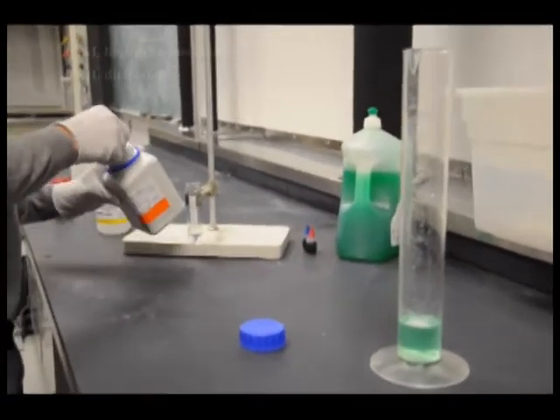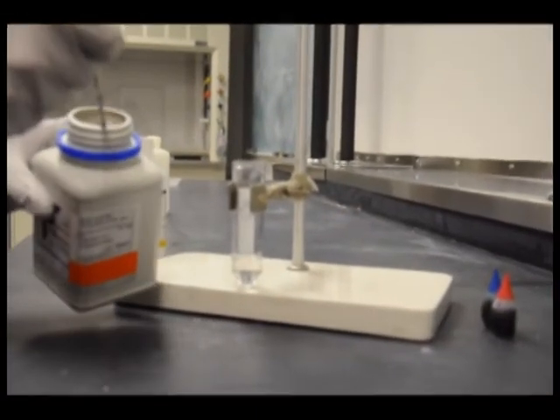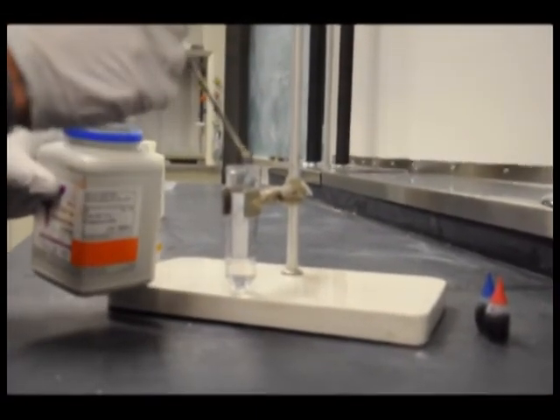Now you must create a saturated solution of potassium iodide in water. The solubility of potassium iodide is about 14 grams per 10 milliliters at room temperature.